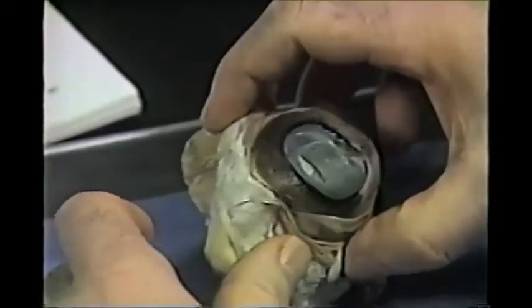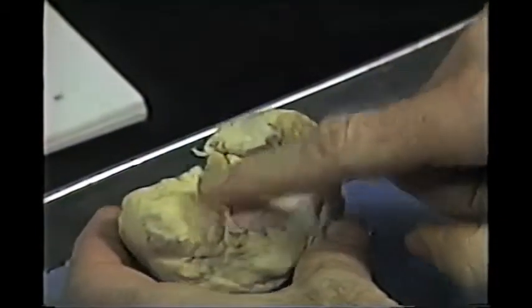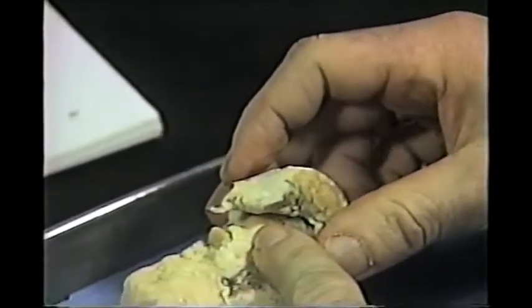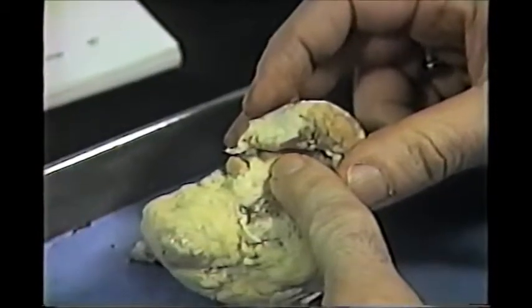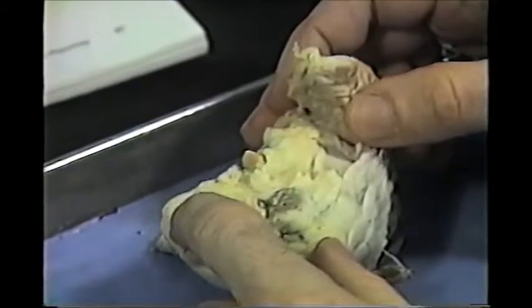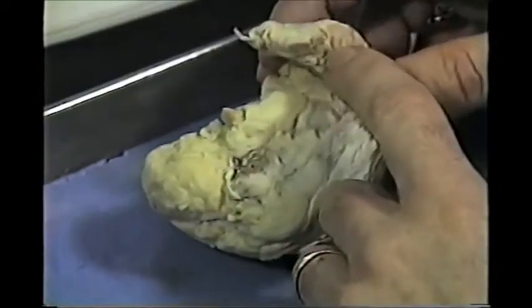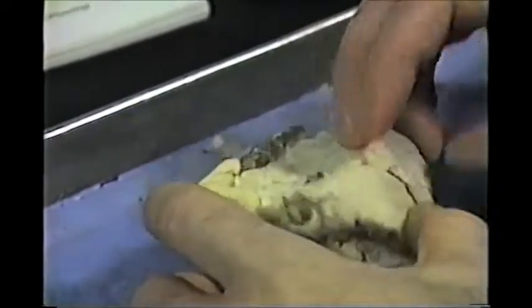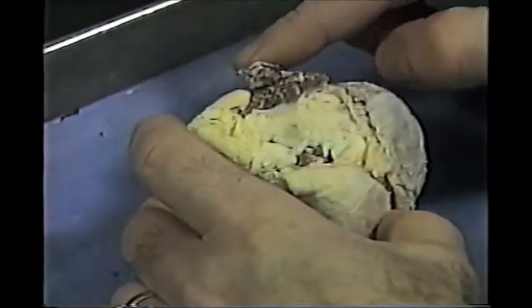If we look at the back of the eye, we see a lot of fat, and that's there for protection. This sits into a bony socket of the skull, so we need a lot of protection, and that's what the fat does. You also will see muscle — the brownish material here — which are the big muscles that would move the eye up, down, right or left.